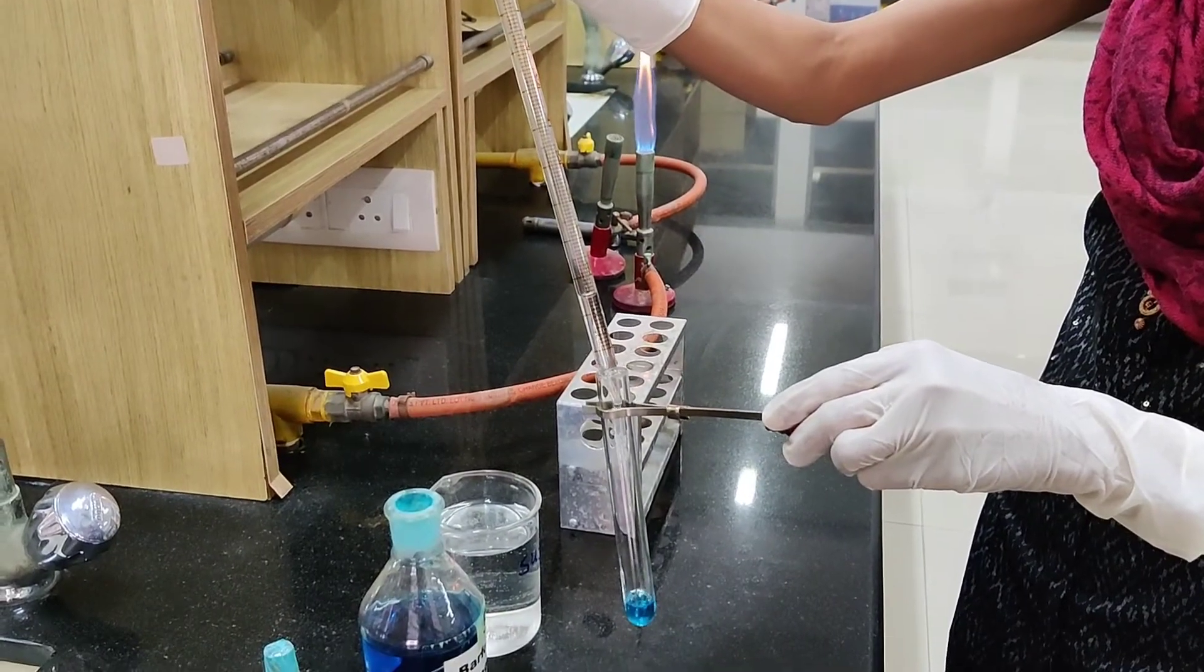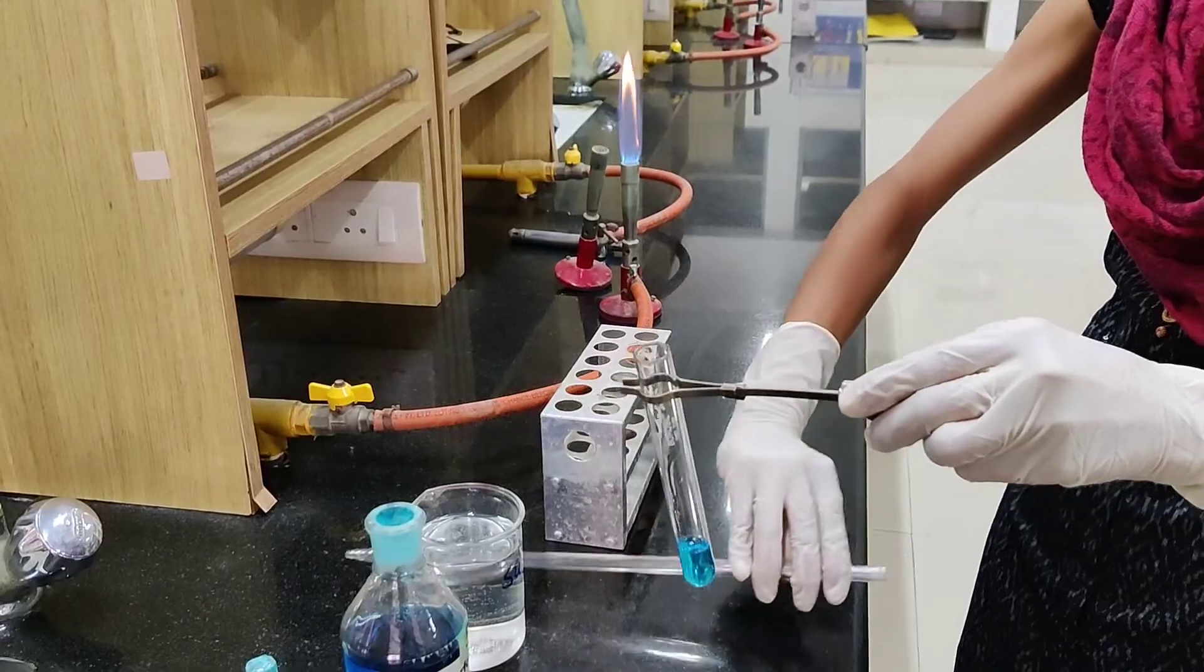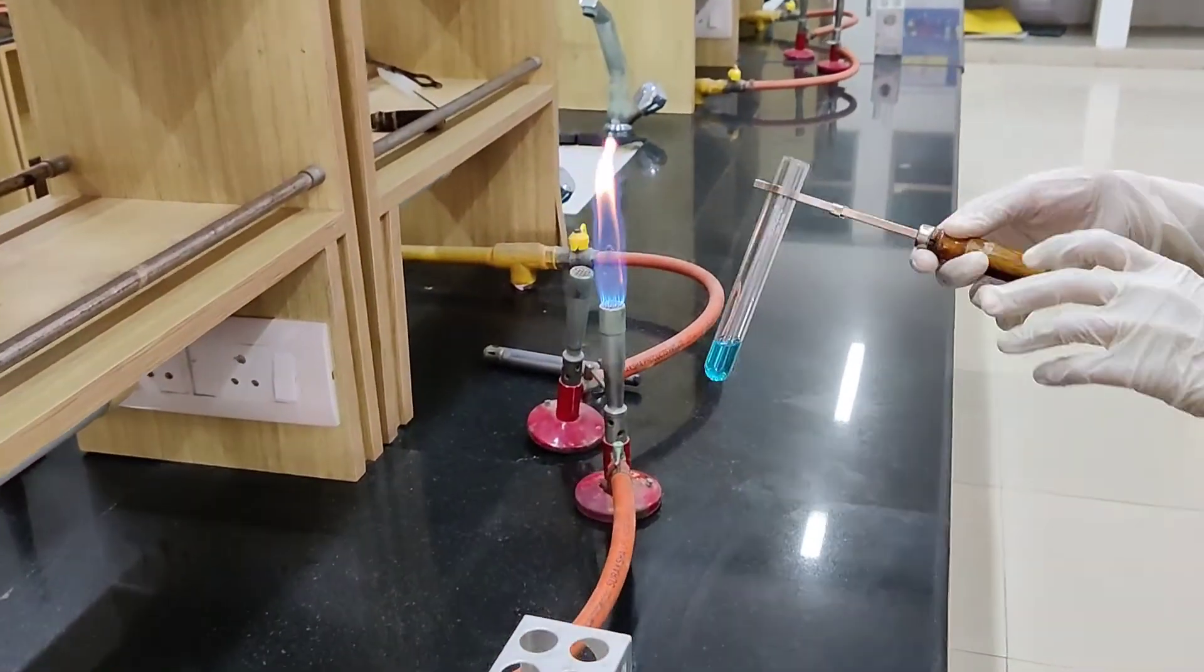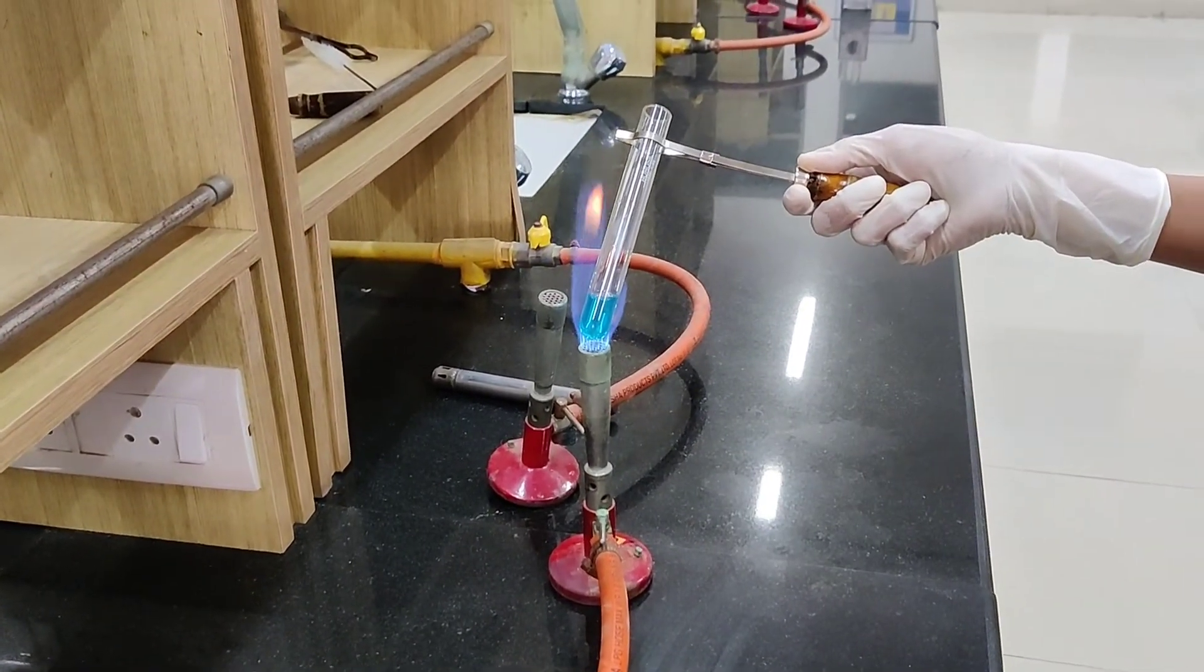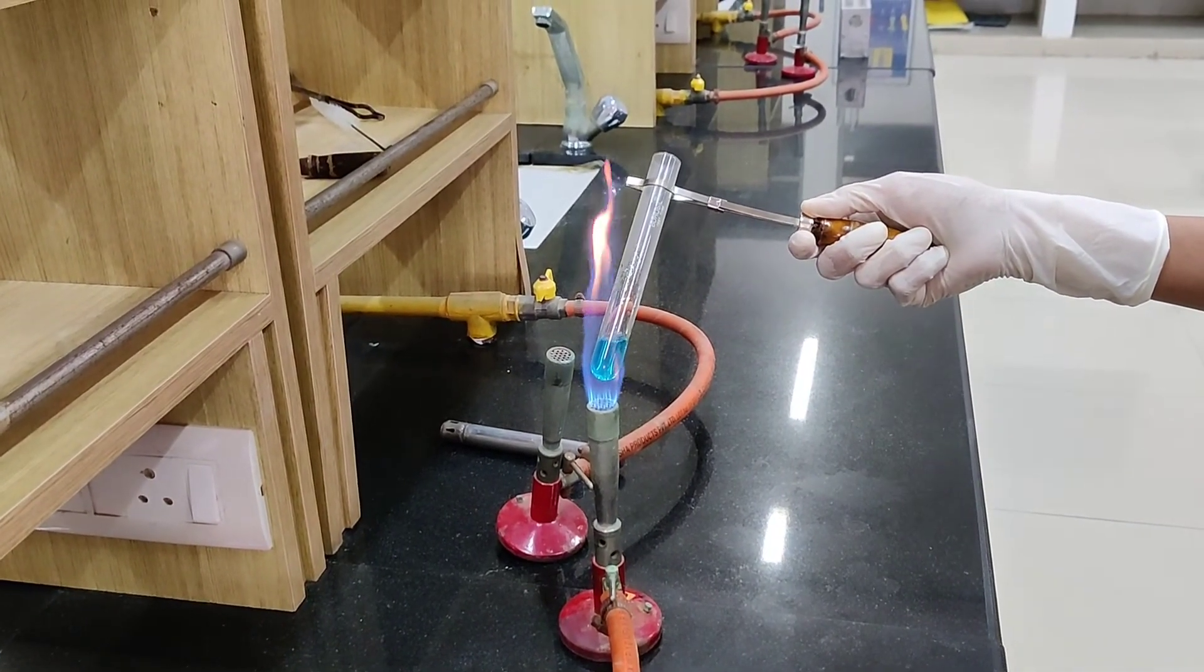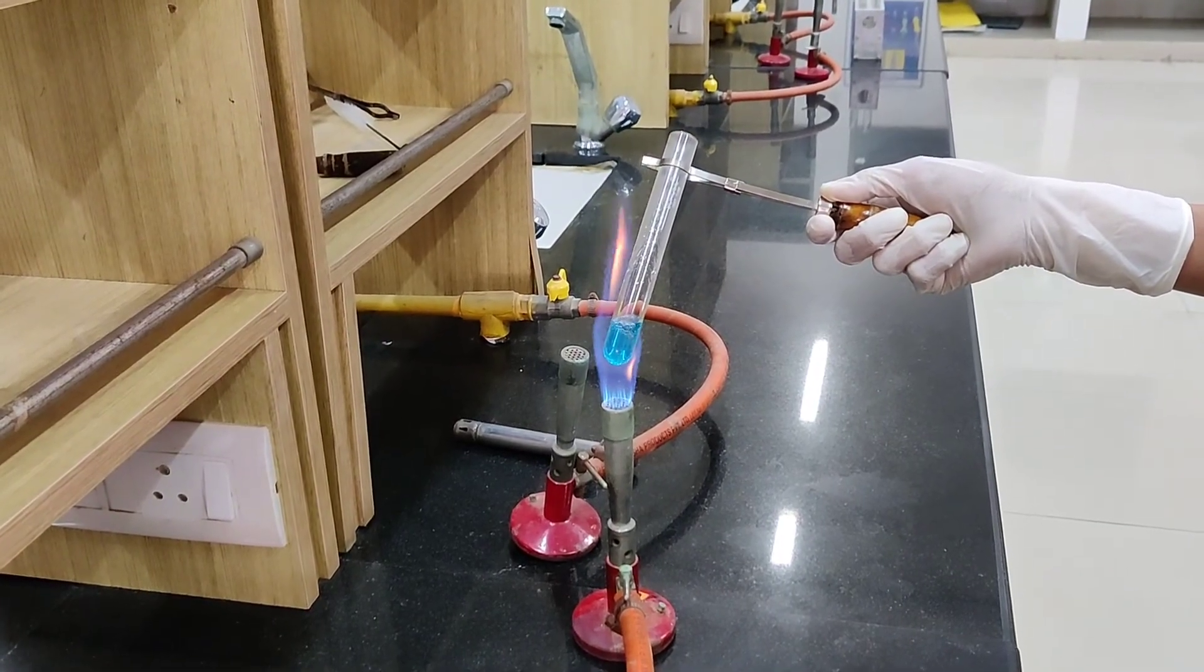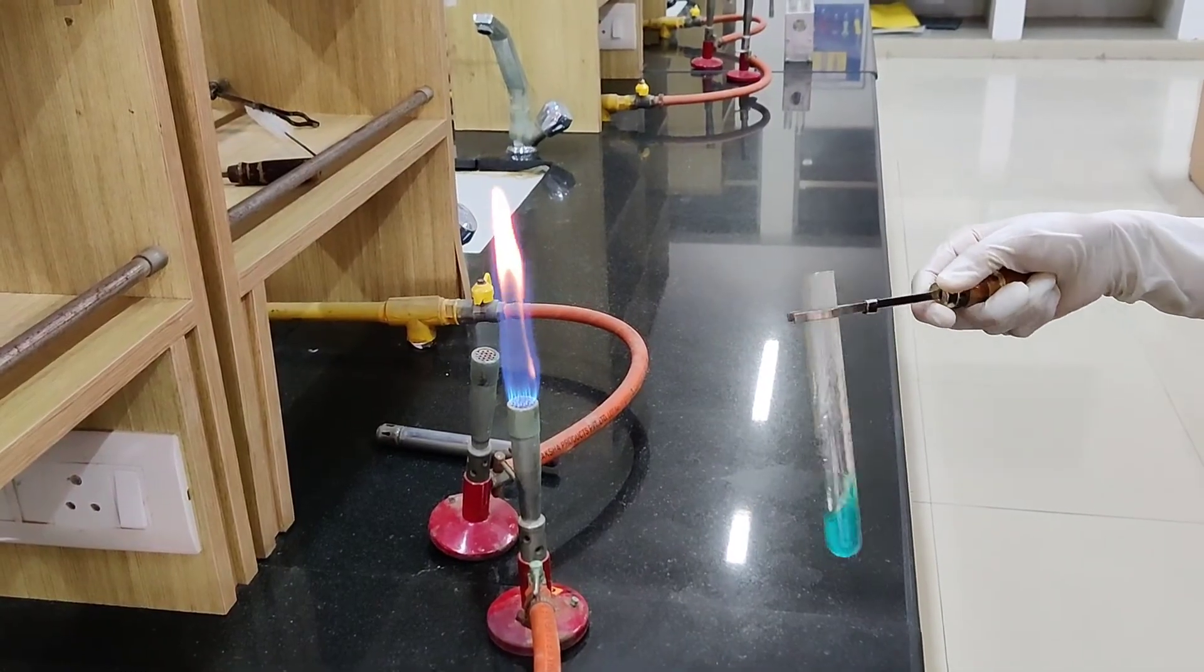After adding it, mix it properly, then heat it on the flame. After heating it, allow it to cool down.